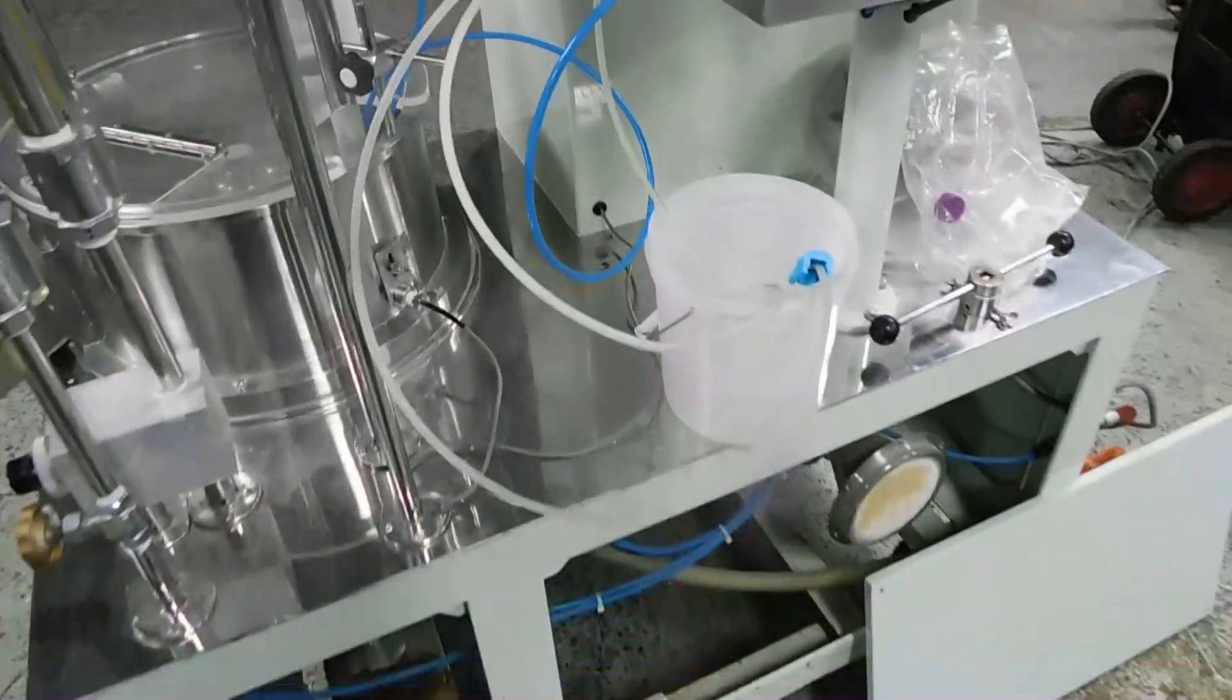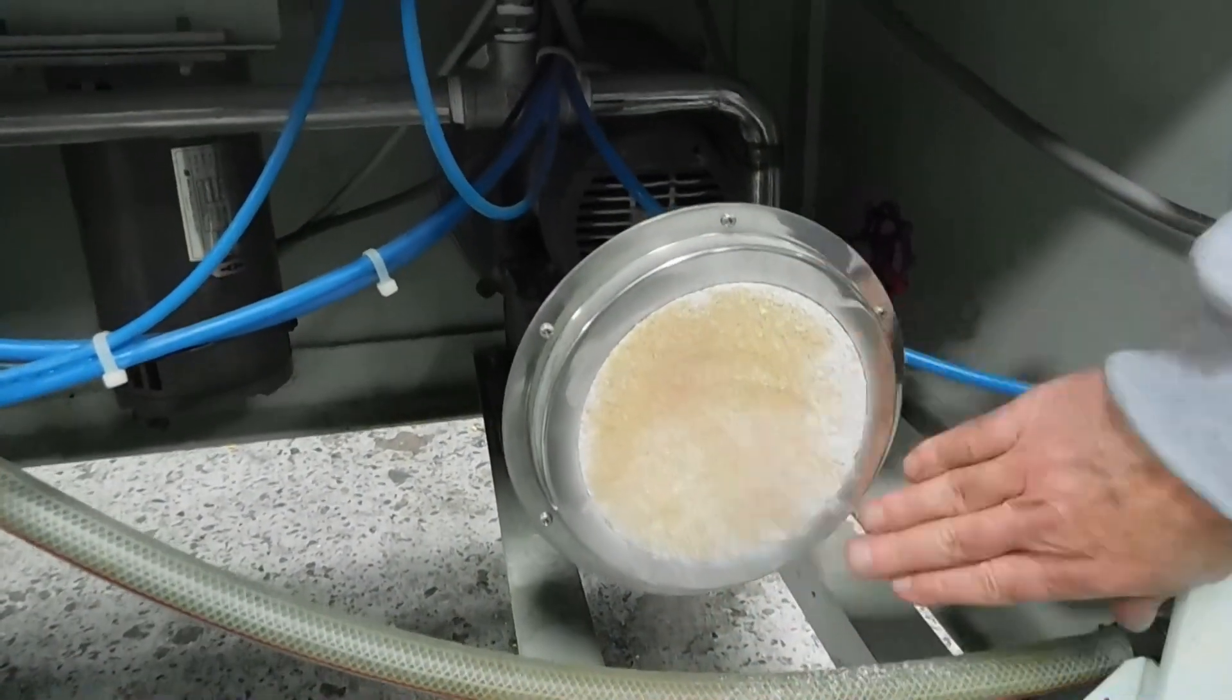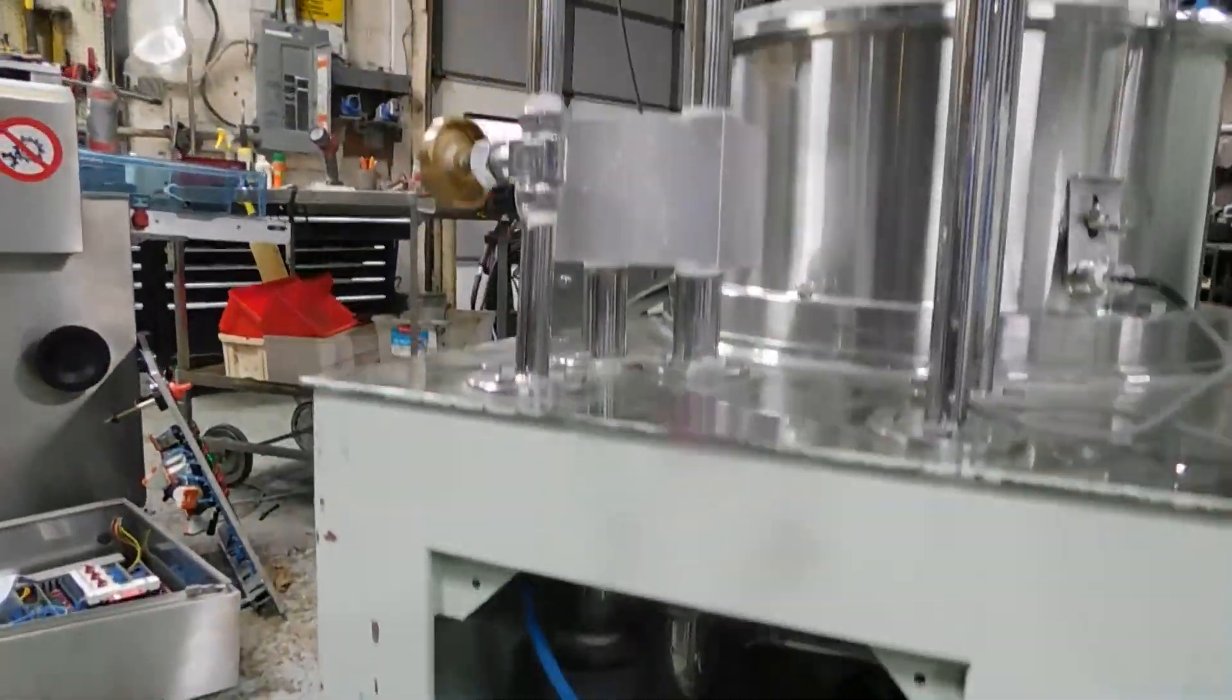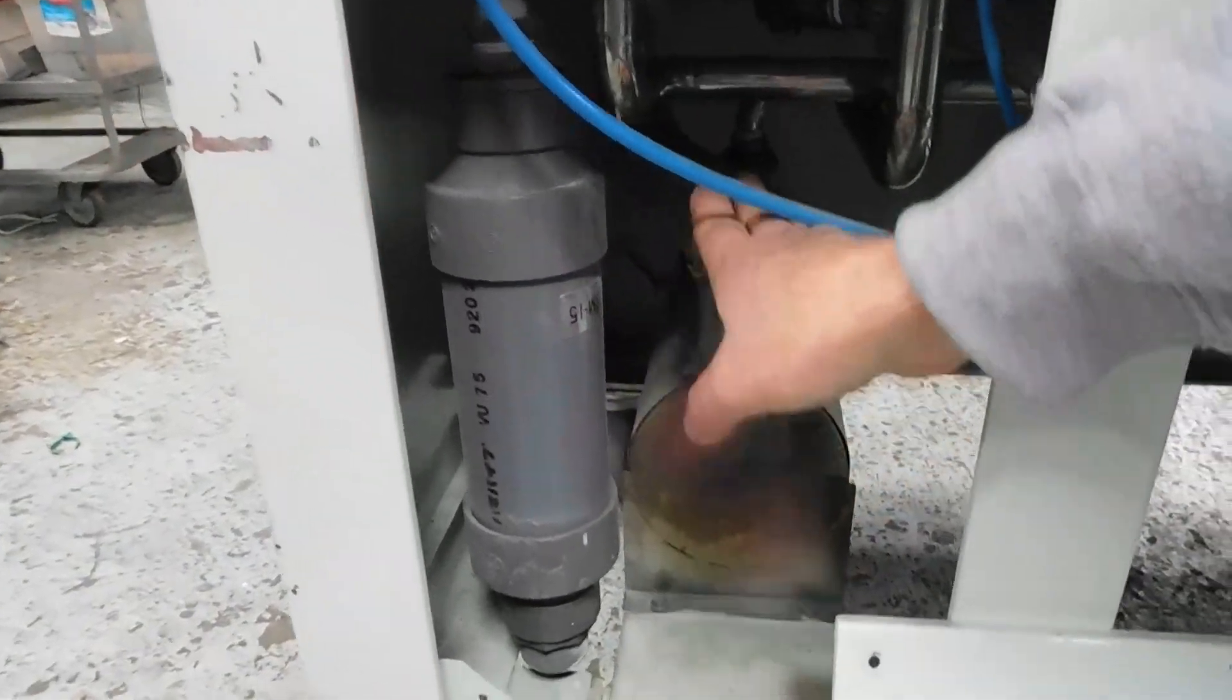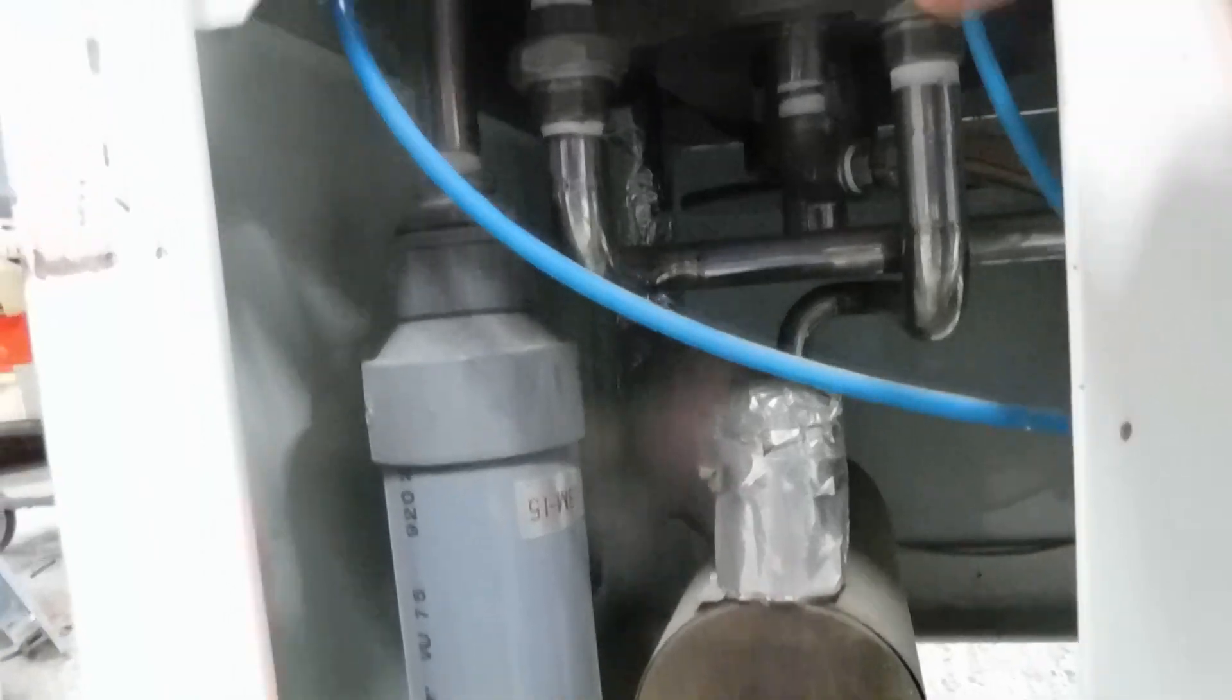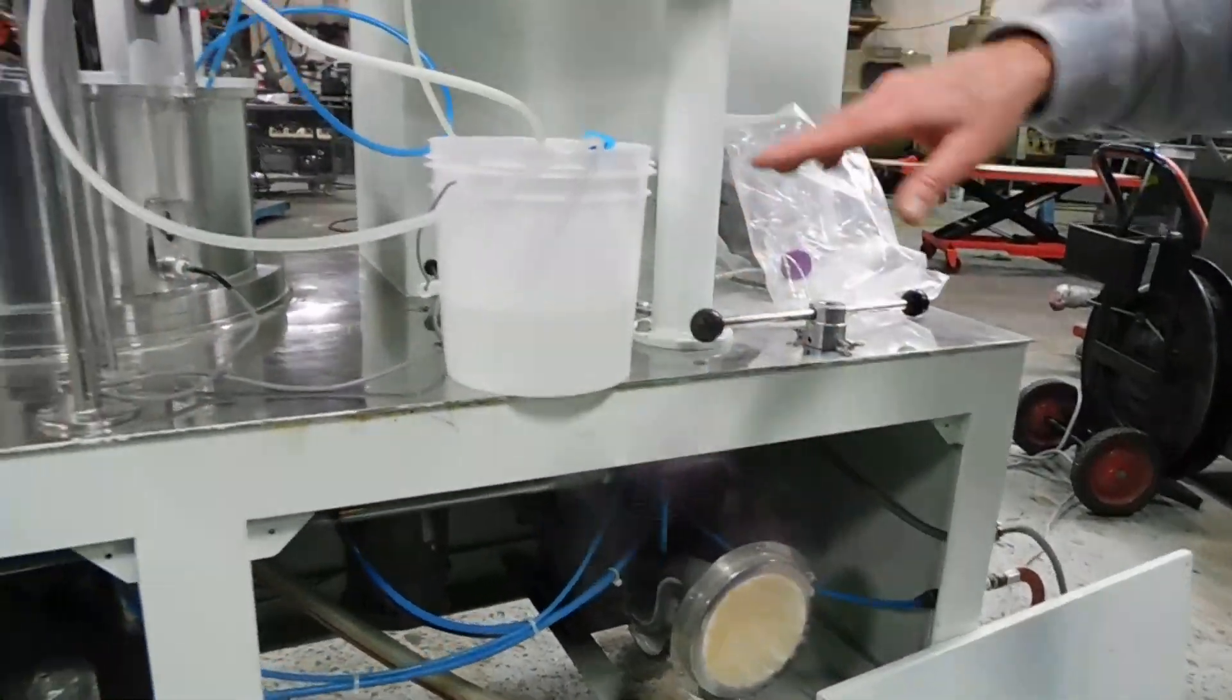While we're back here, I'll show you inside. We have the covers removed. So right here, this is your intake blower. You can see it's a little dust on it from when it was previously used. So the blower pulls in, discharges the air across, up through the manifold up here, and then into the heat exchanger down in the bottom. Now this is the heat exchanger right here. You'll see this is discharge air. If you just back up a little bit and see underneath, you'll see the far side, the discharge air goes up into the bottom of the bowl. And that's what's heating the bowl right now. So it's always taking a supply of fresh air through the filter and in to heat the bowl.